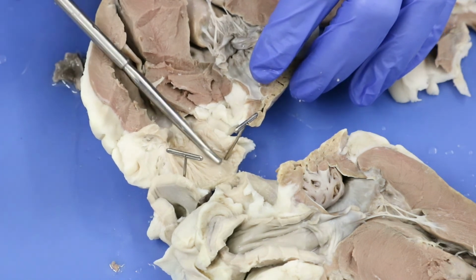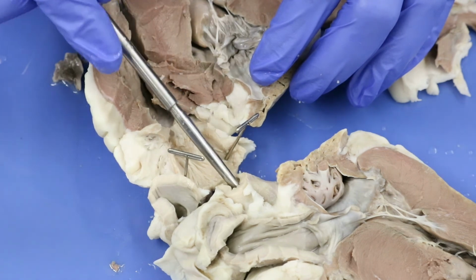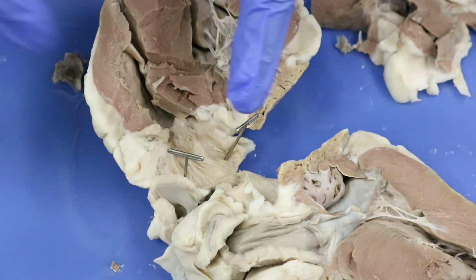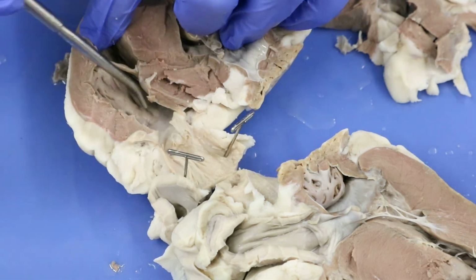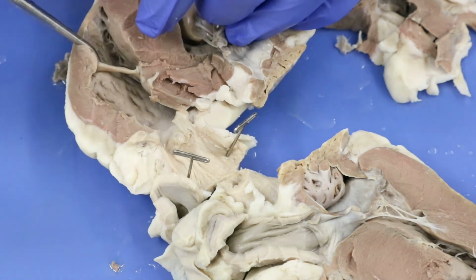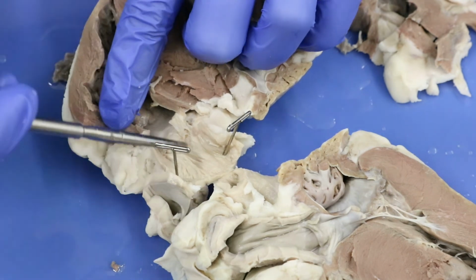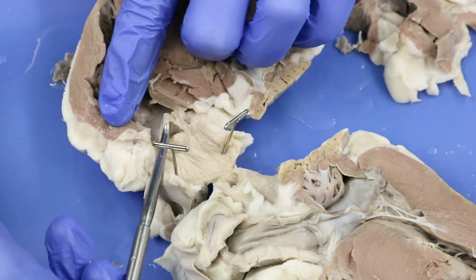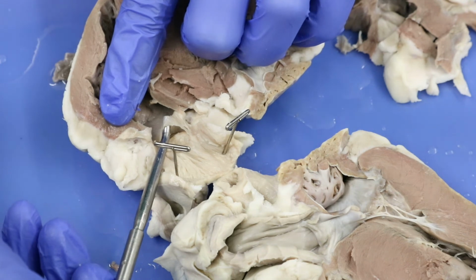All right, folks, you see the probe is still in here as this portion. I'm going to go ahead and pull it out. So this here is still our pulmonary trunk. We have the undissected portion here, and then this side I have splayed open, and I put 2 pins to hold it open for us. So we can still see in here, we have our right ventricle. We see our right ventricle much better than we did before, and we see all that nice trabeculae carneae in there. We also see right here that this tissue that I'm holding up with the probe is the pulmonary valve.